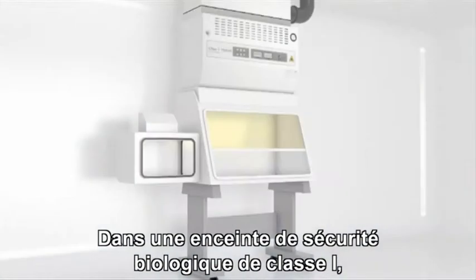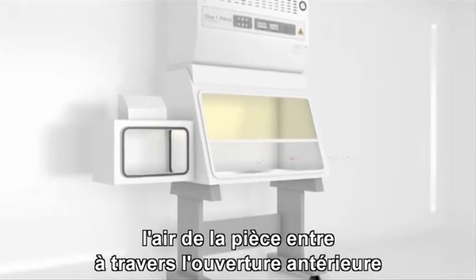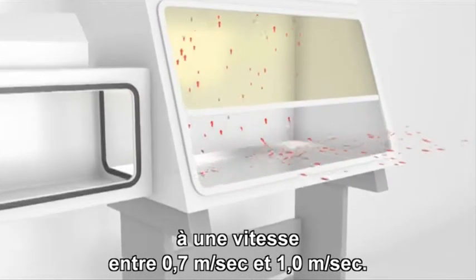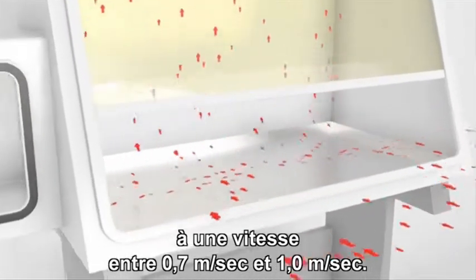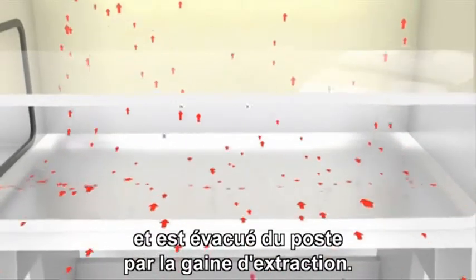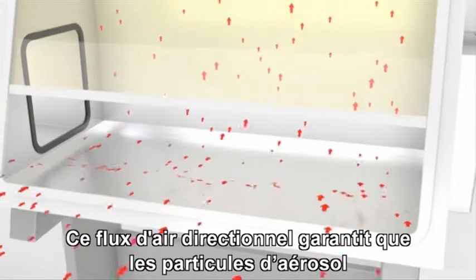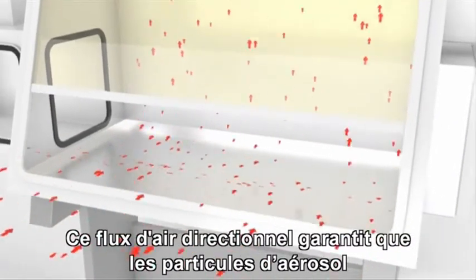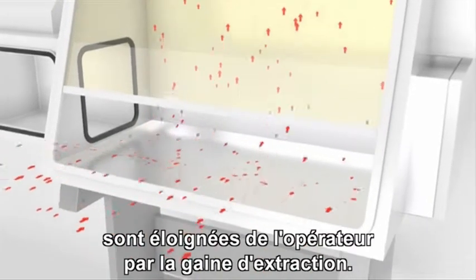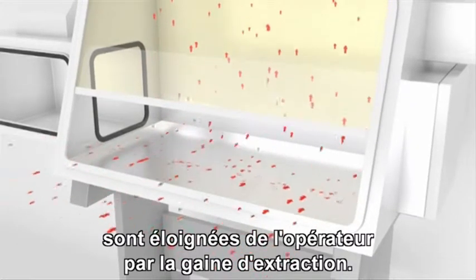In a Class 1 biological safety cabinet, room air is drawn in through the front opening at a velocity of between 0.7 meters per second and 1 meter per second. It passes over the work surface and is discharged from the cabinet through the exhaust duct. This directional flow of air ensures that any aerosol particles that may be present on or around the work surfaces are taken away from the operator and into the exhaust duct.